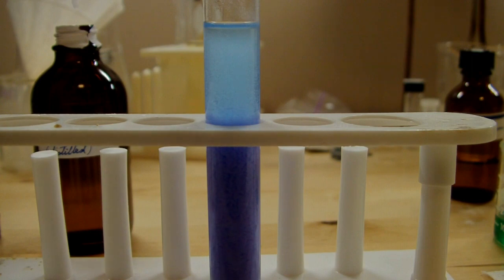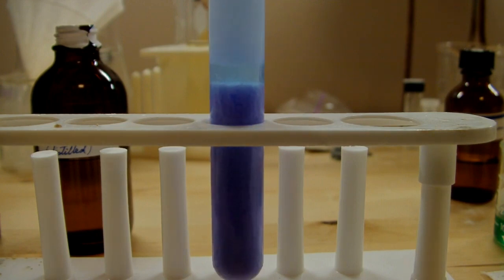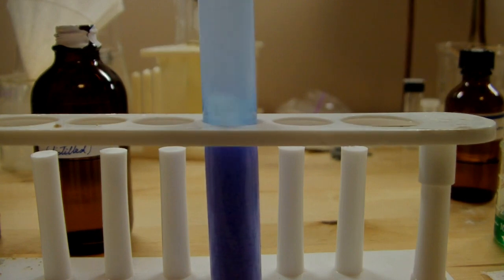Now you can see when I add more acetone, it should drive more of this precipitate out of solution. You can see now there's almost three distinct layers. So we'll give it a stir.